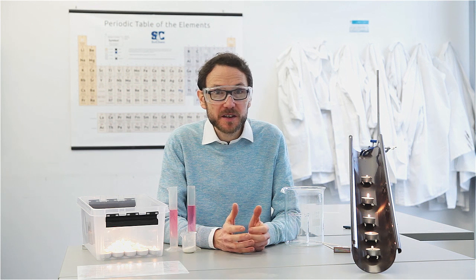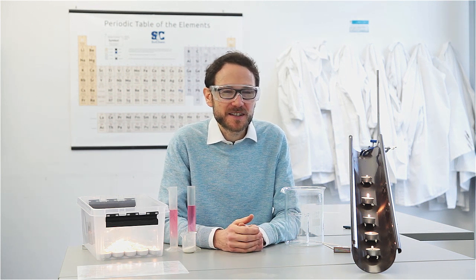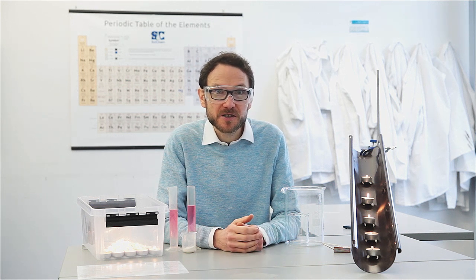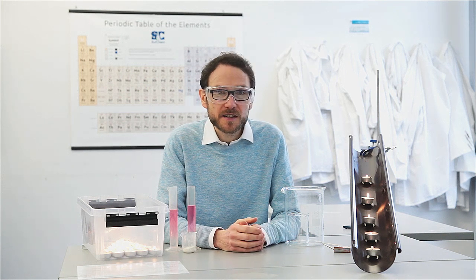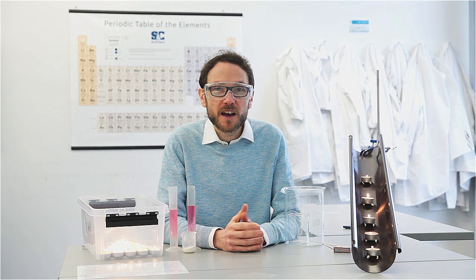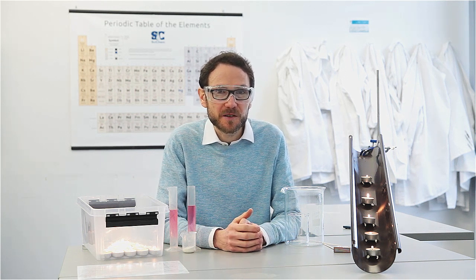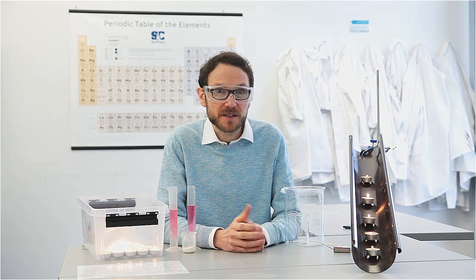Following the last video, I had a little bit of feedback asking for some simpler demonstrations for students lower down the school. So this time I thought we'd go for something a little bit simpler, and we're going to be looking at the density and the extinguishing properties of carbon dioxide. Let's have a look at a number of different ways that you can do this with your students.